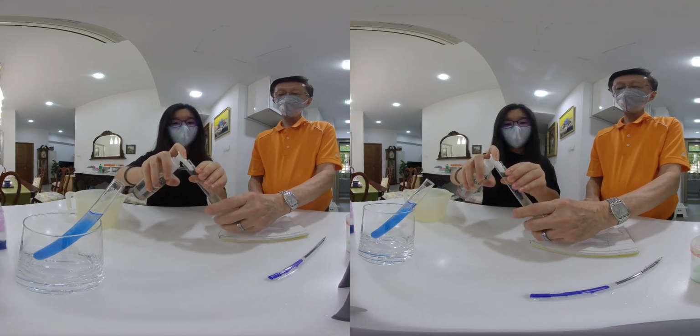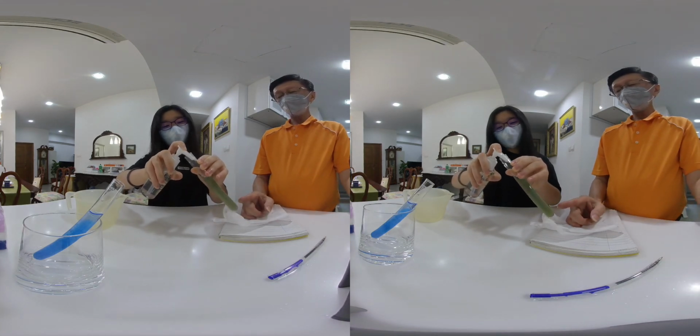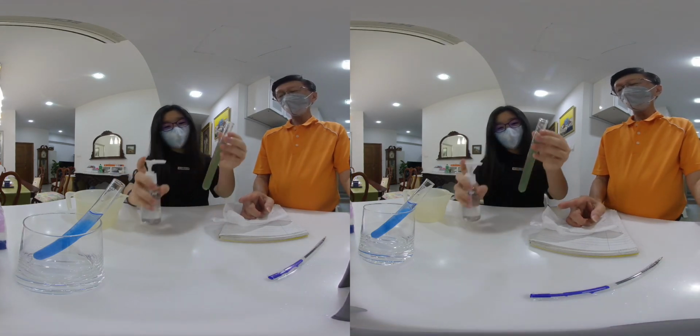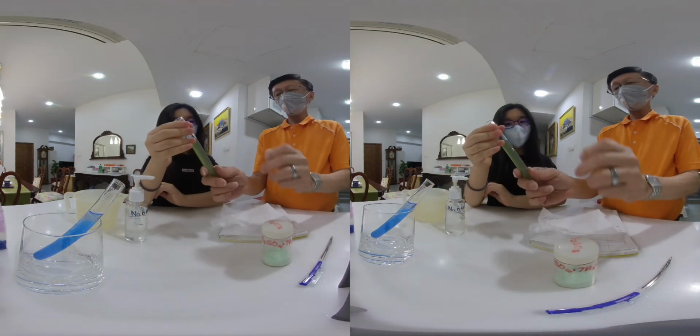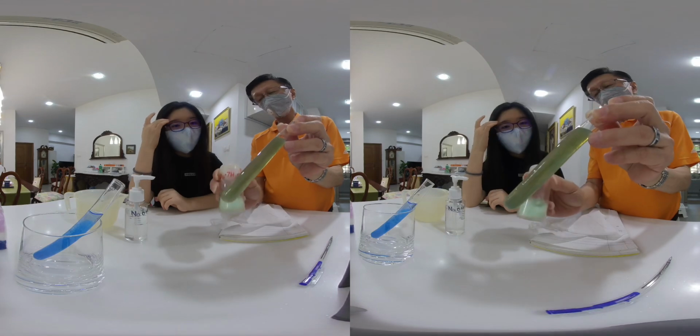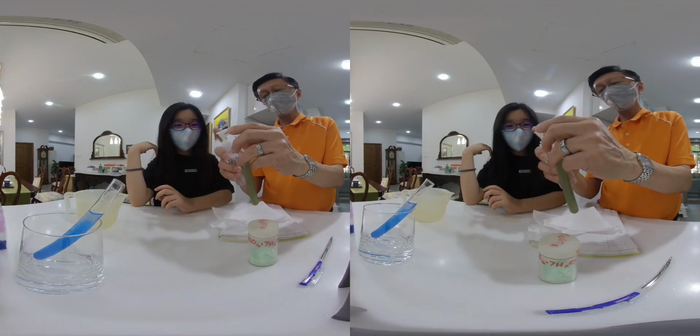What's the PPT? Oh, the PPT is a dirty green precipitate. Again, the iron 2 sulfate is a limited amount, and you have excess sodium hydroxide.